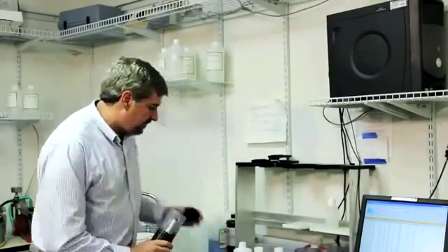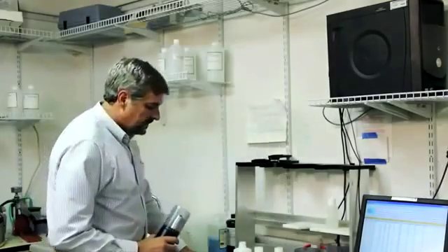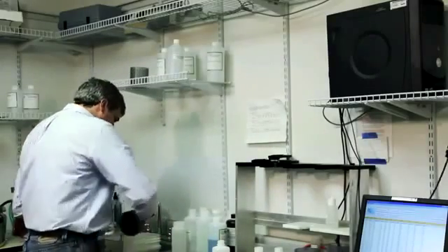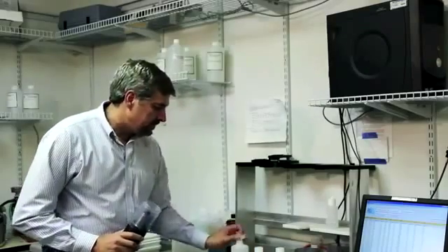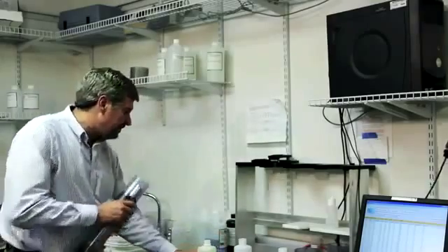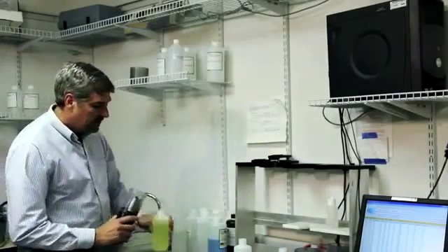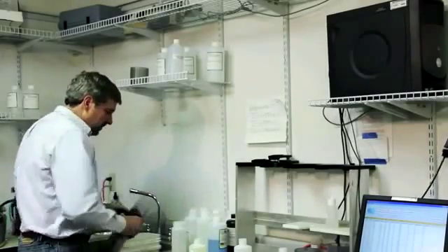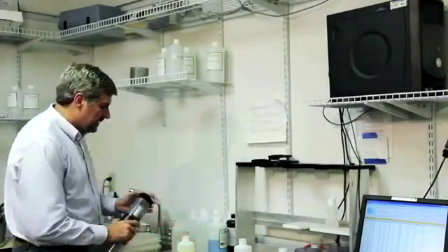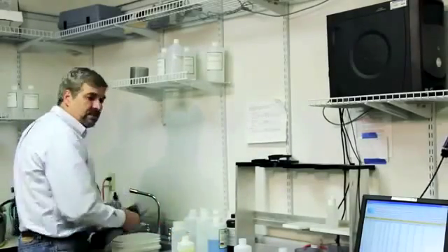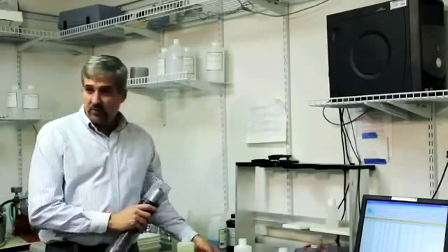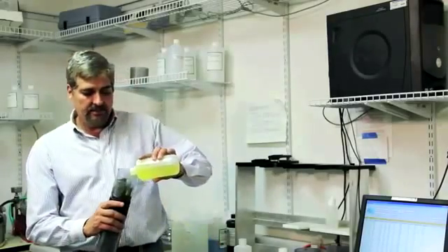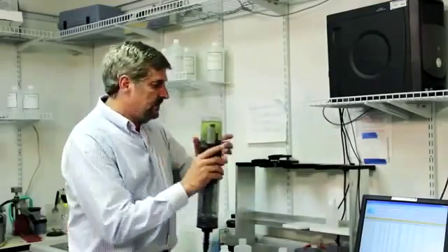So I rinse. Repeat. And a 7 buffer. Pour a little in there. Cover the sensors. Pour it out. Rinse again. And for the sake of speeding up this video, I'm only going to do one rinse, one rinse with the DI water, one rinse with the solution.